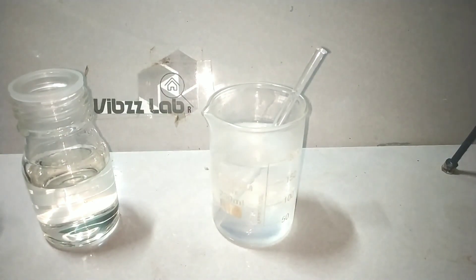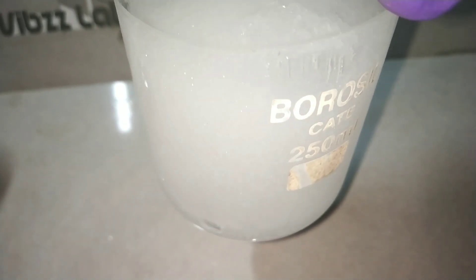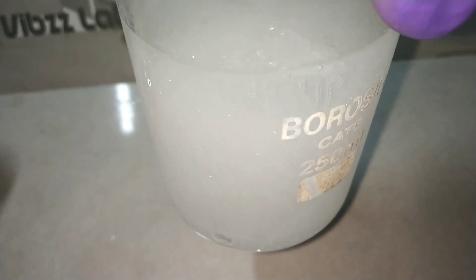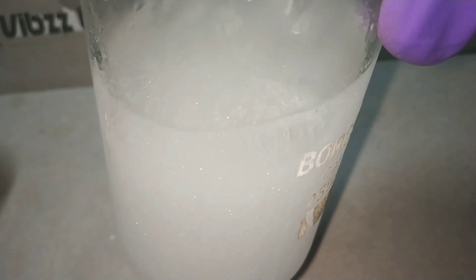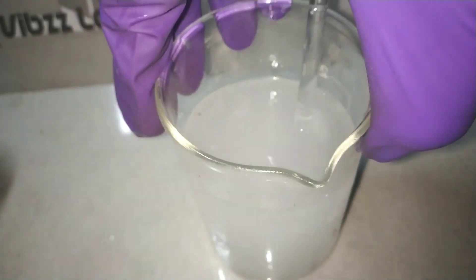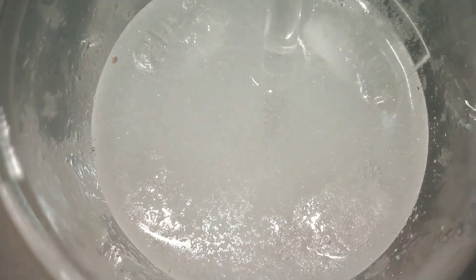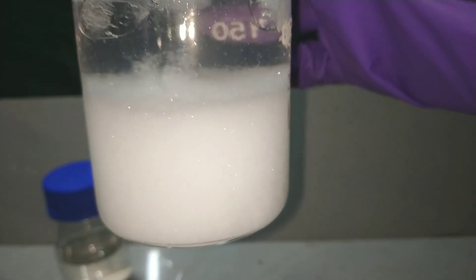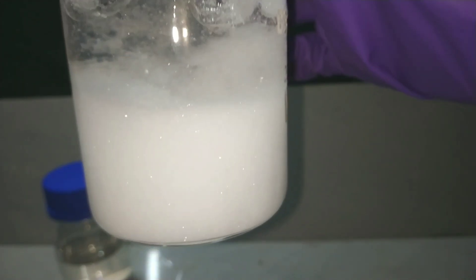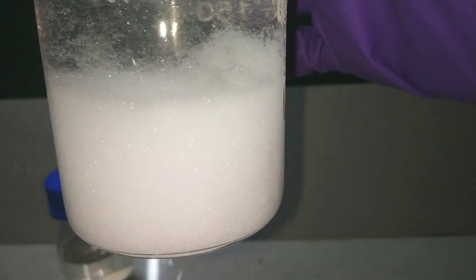Now we will keep the beaker undisturbed for 5 to 10 minutes and you can notice that beautiful crystals of Hippuric Acid have separated out from the solution and are slowly settling down. After about 5 minutes, you can see the crystals which have separated have settled to the bottom of the beaker.